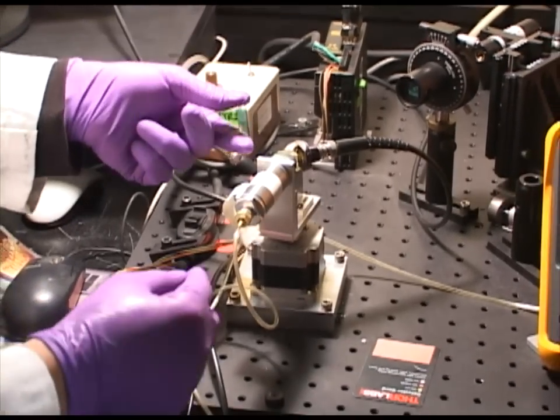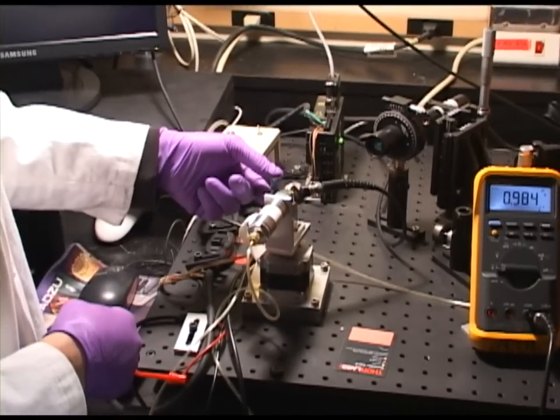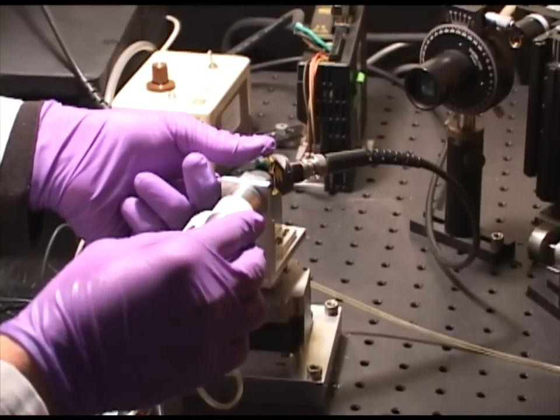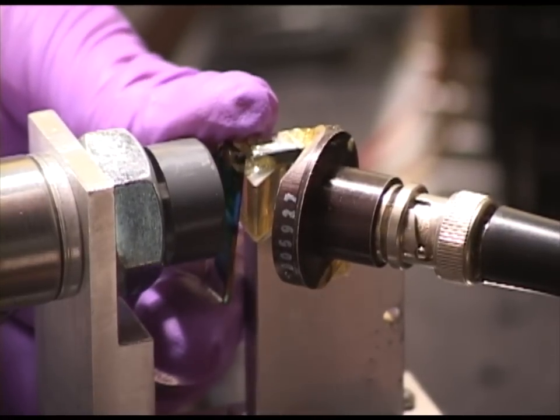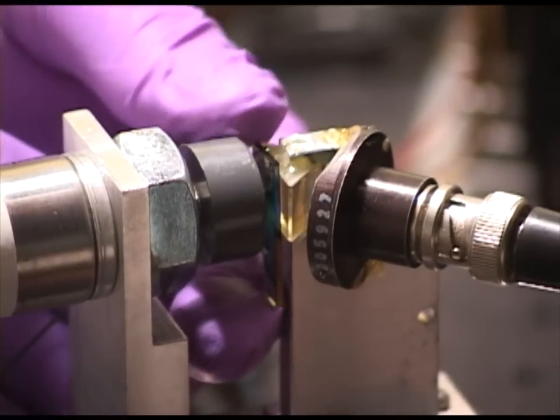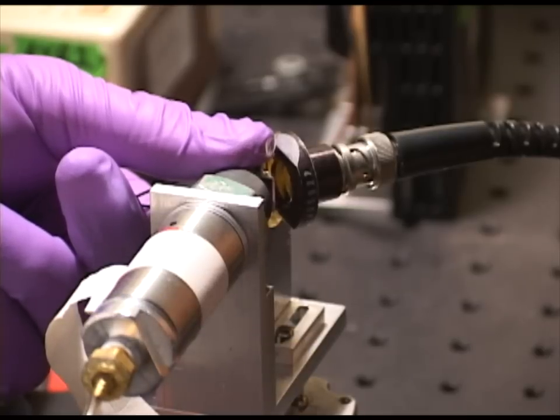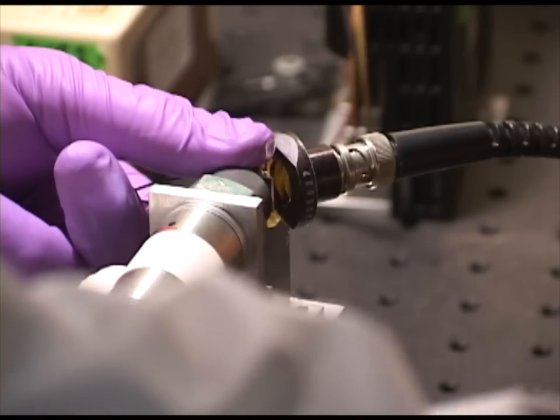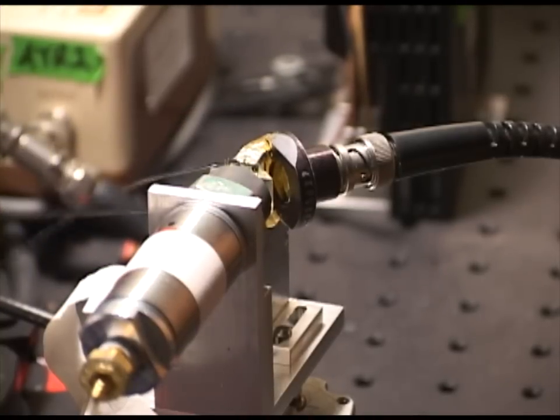It's important that the point of the pneumatic piston lines up directly over the upper gold electrode. So we slide the sample in here between the prism and piston, and we carefully align so that the point of the piston rests just over the gold electrode. When it's properly placed, we activate the piston, which will then press the sample against the prism.